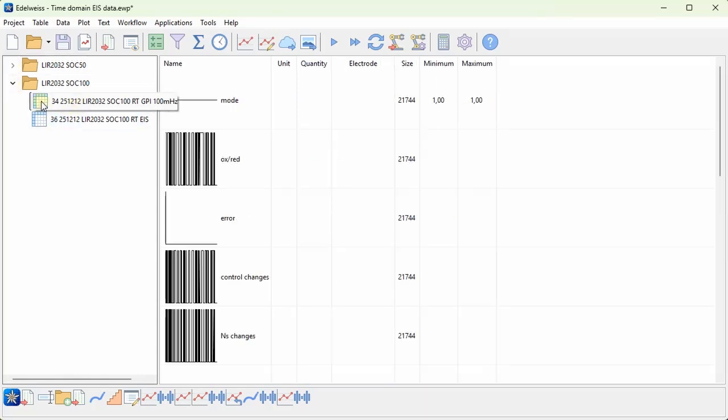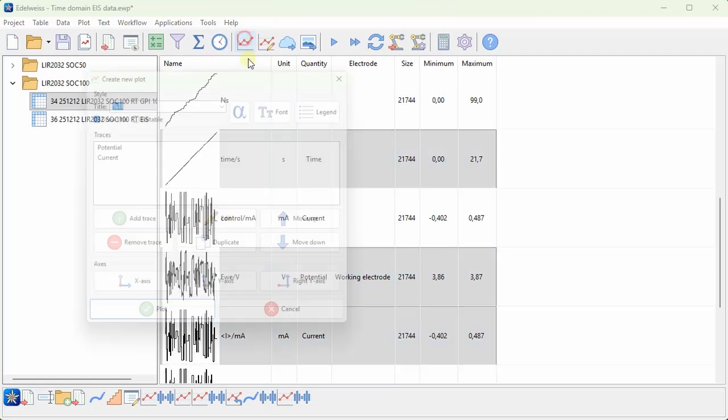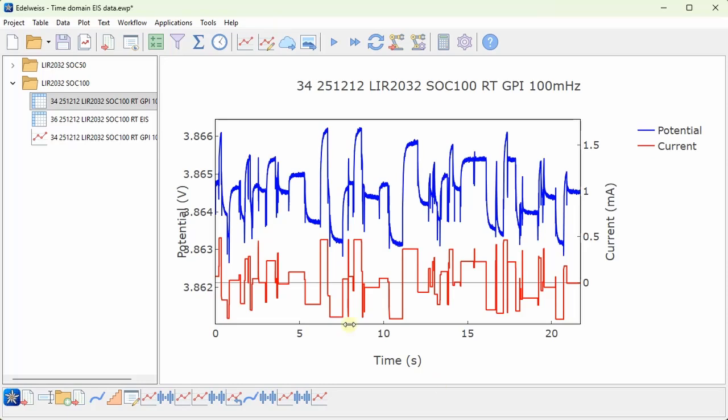This is measured by a Biologic SP200 potentiostat, and I can show you the potential and current versus time traces. So as you can see, this is kind of semi-random current steps and the corresponding potential. And based on this data, we can actually calculate the impedance of the battery cell. And this can be useful for quite low frequencies, since this takes a long time to measure with normal EIS. But when you do these kind of time domain measurements, you have a lot shorter measurement time.